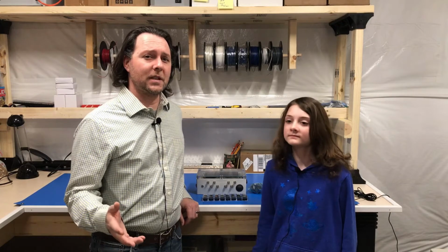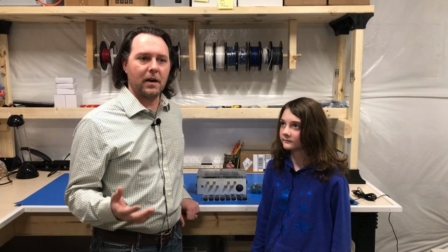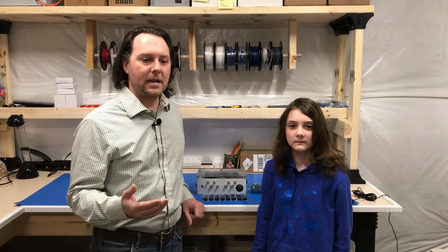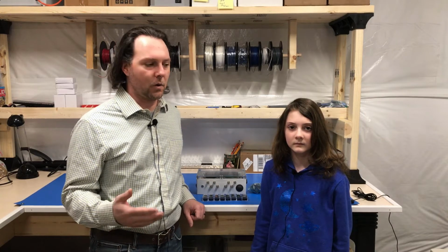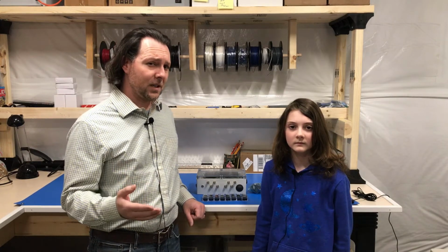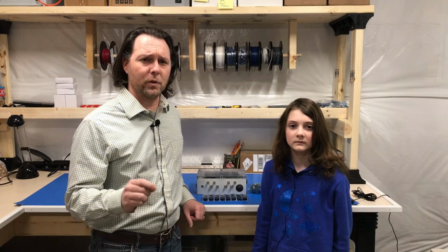And we're going to show you today how to use the AutoConfigure function on the Water Feature 8 system. We get asked this question often: how do I get started? I plugged in my EZO circuits and they're not working. We forecast this a long time ago. We had the same problem when we developed the Water Feature 8 system. And the solution was we programmed in an AutoConfigure function that allows you to quickly and easily install the EZO circuits, turn on the machine, and it will automatically program them to work with the Water Feature 8.